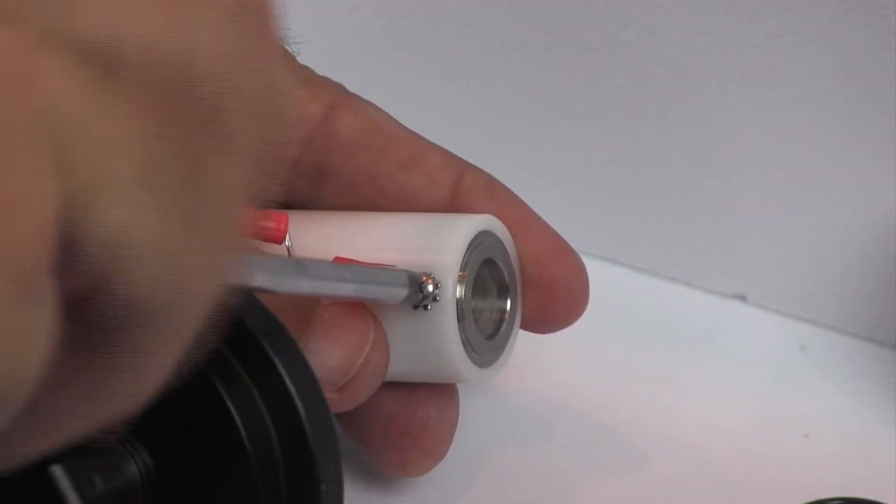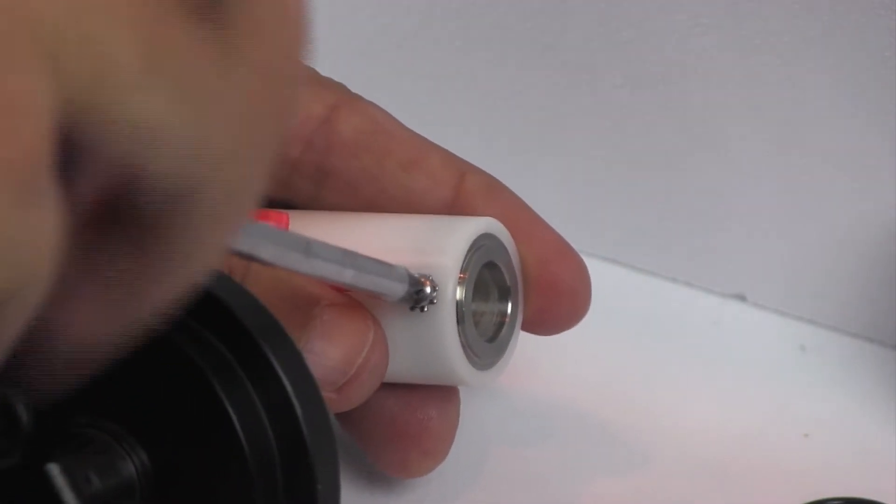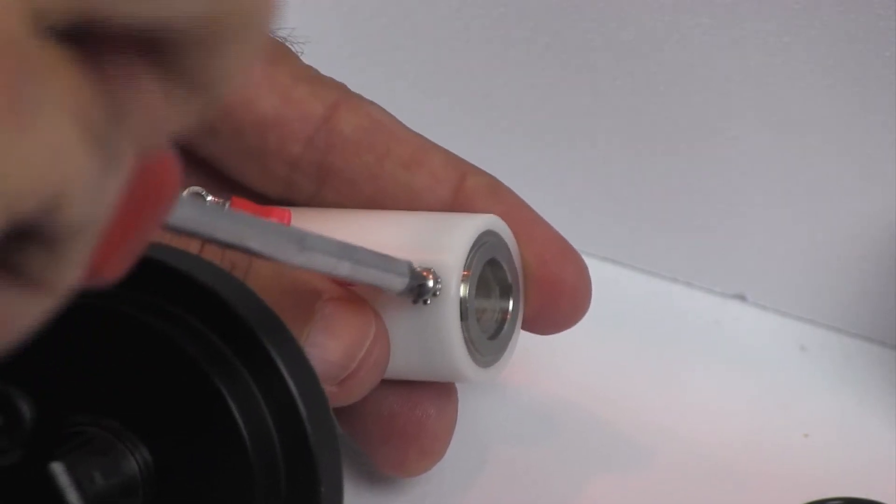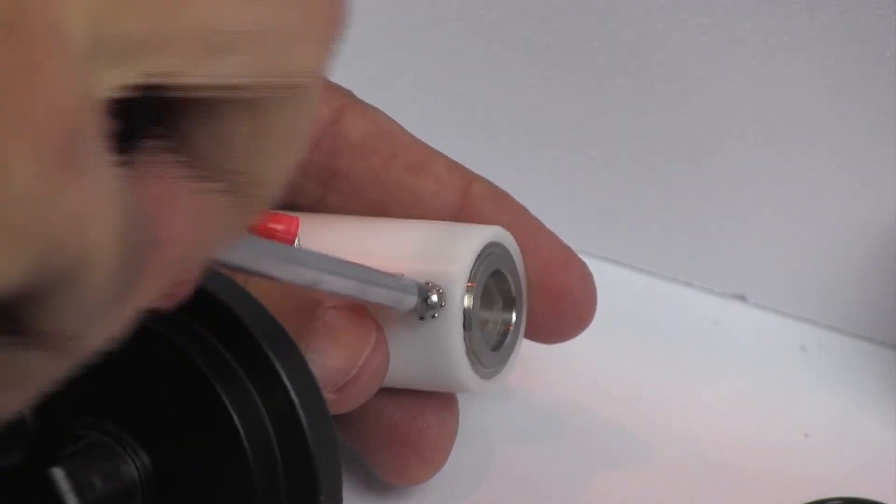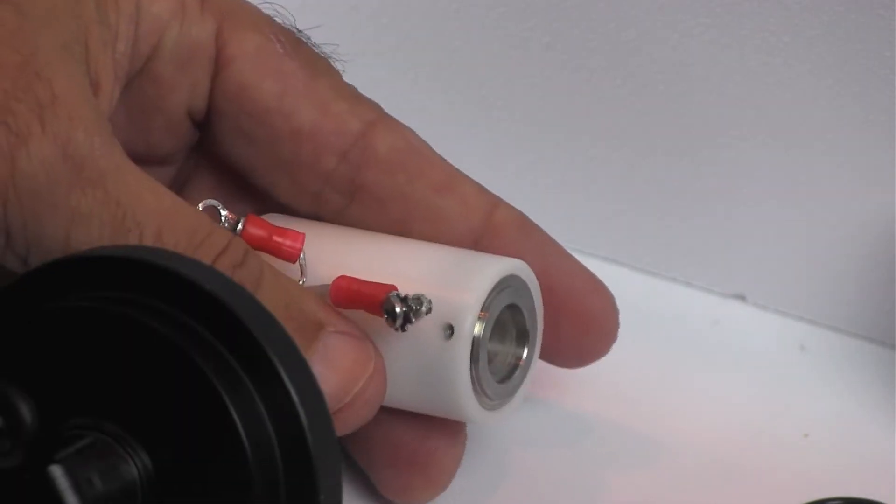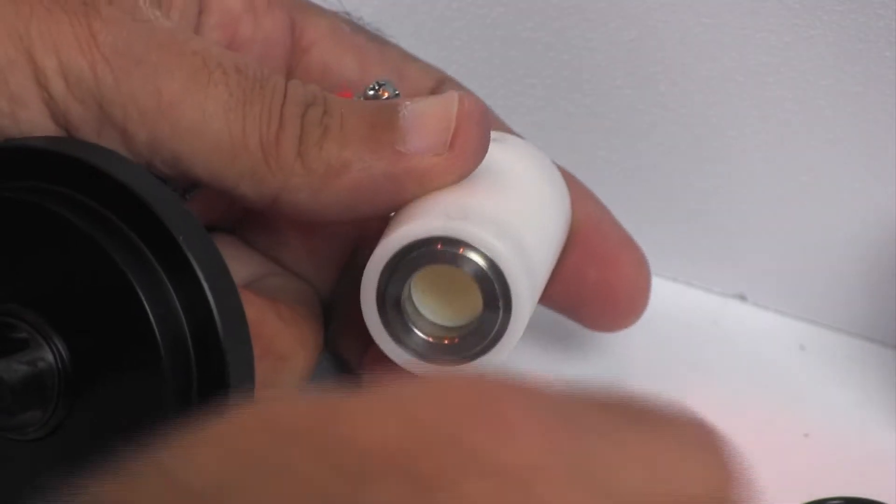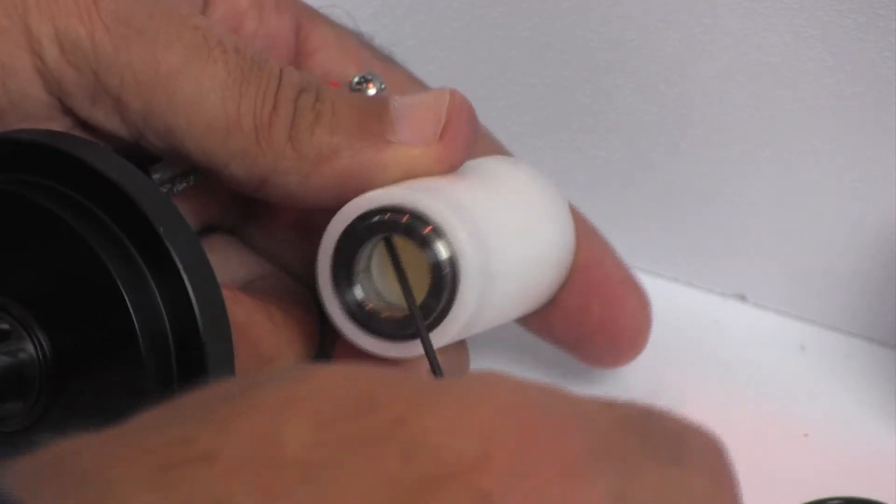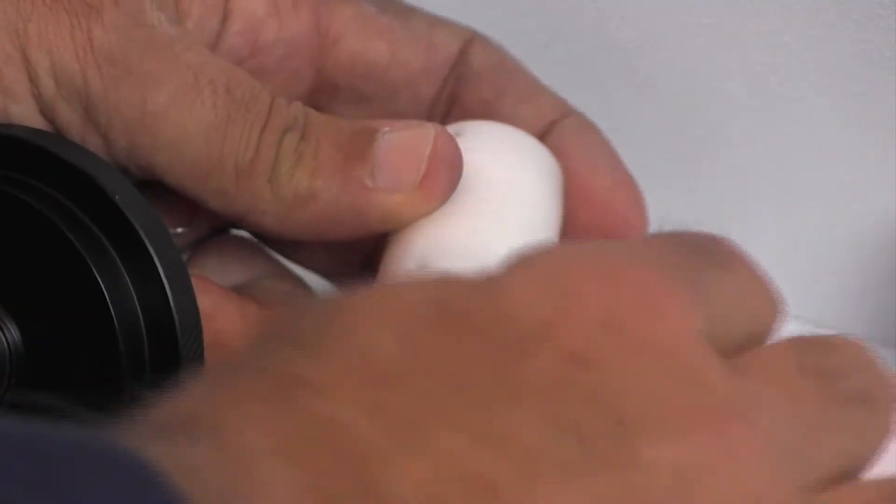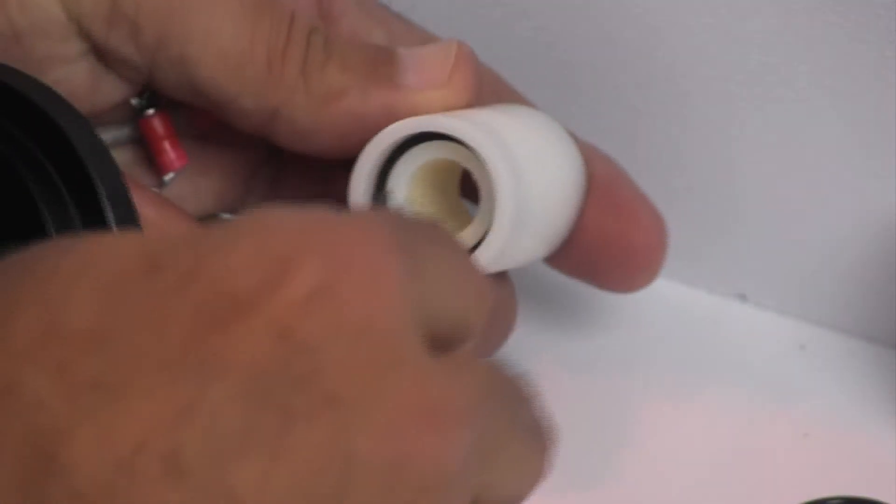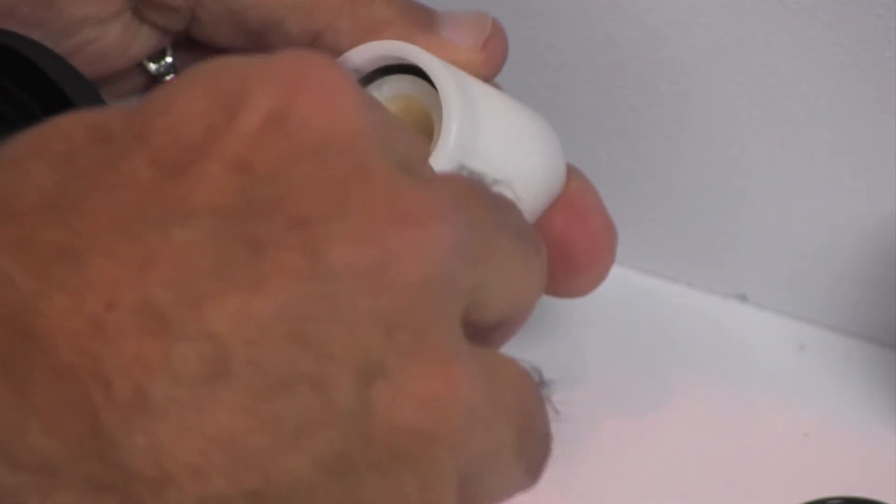Repeat the process for the electrode on the opposite end of the sleeve. Set aside the two electrodes for installation in the new sleeve and discard the used O-rings.